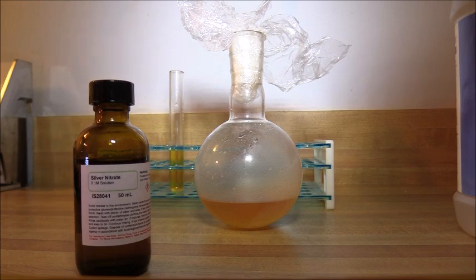This was both a good and bad result. I would later find out that the brown color was due to the presence of an intermediate compound in the synthesis of purines from formamide called diamino maleonitrile. However, the purine test when done this way is supposed to produce a white precipitate, and so I had trouble reconciling the fact that the precipitate was supposed to be white with the result that I got.